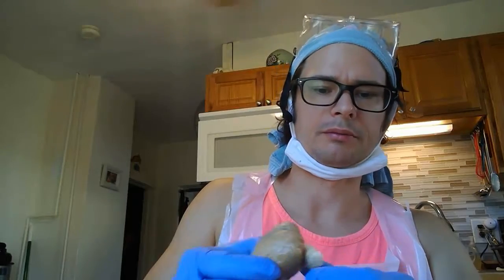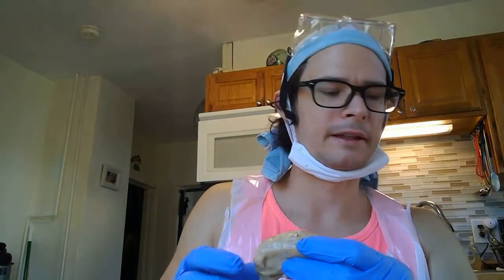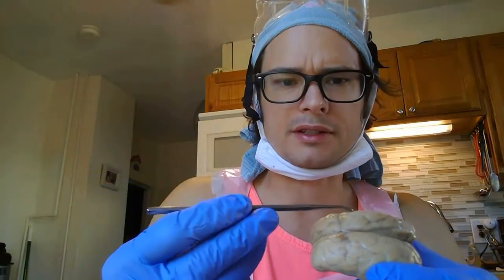So what I had before I split it, we got our longitudinal fissure, frontal lobe, parietal lobe, occipital lobe. Here is the cerebellum with the arbor vitae as well present, and the temporal lobe, and here I have the gyri, which are the prominence of the wrinkle, so to speak, and then the creases are the sulci.